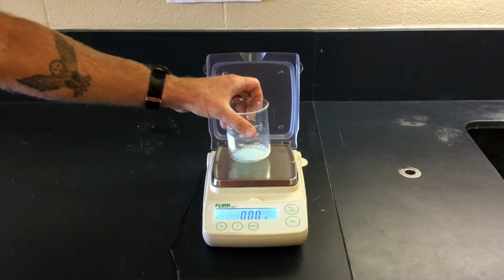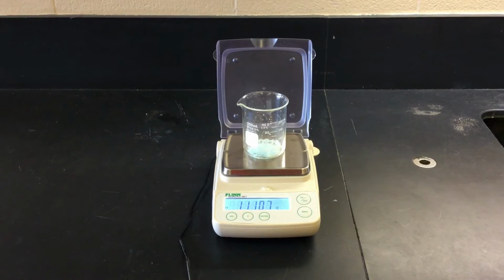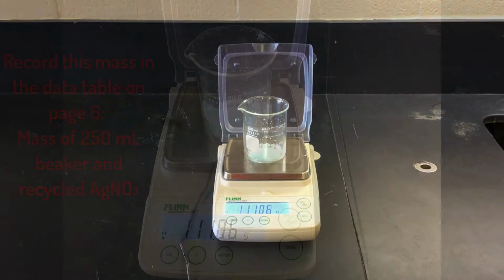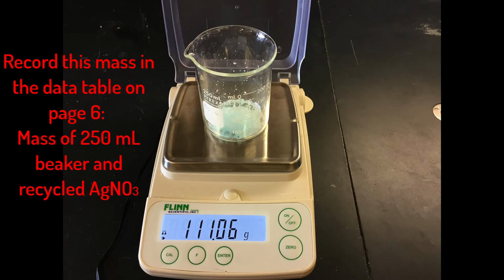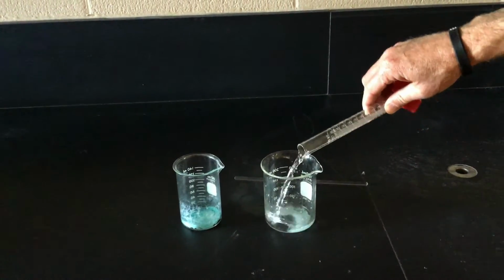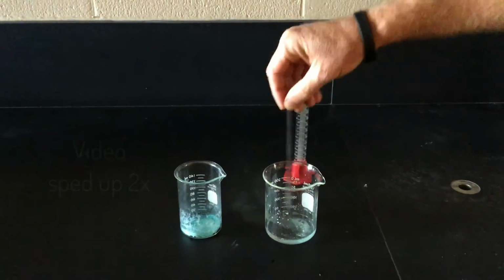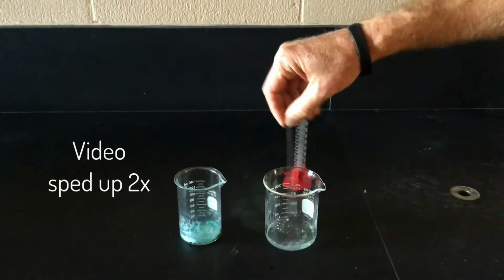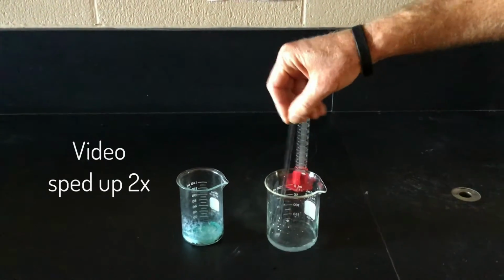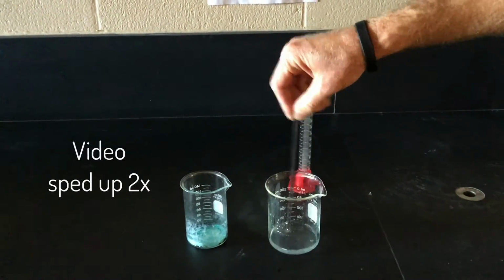So let's mass the 250 milliliter beaker with the recycled silver nitrate. Record this mass in the data table on the bottom of page 6. This is the mass of the 250 milliliter beaker and recycled AgNO3. Now we're going to add 15 milliliters of distilled water and stir to dissolve the recycled silver nitrate. Be sure to address why not all of the silver nitrate may dissolve under step 2 of your lab.